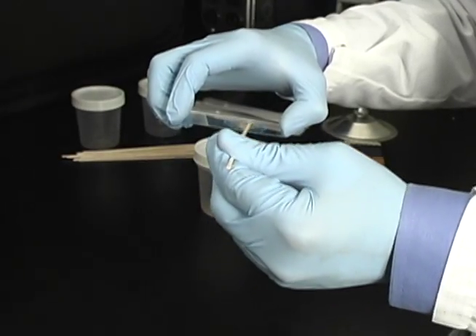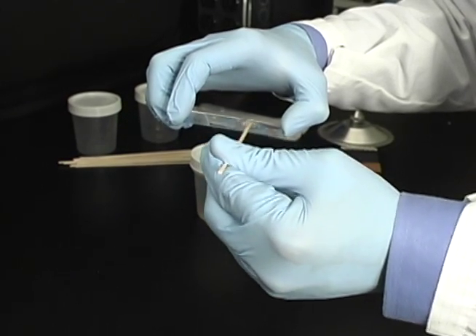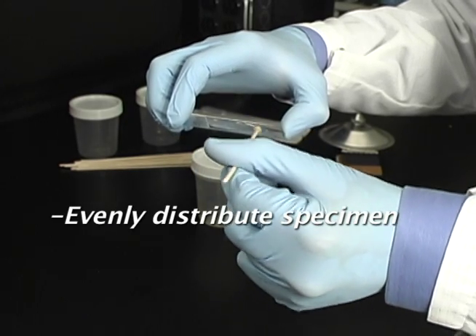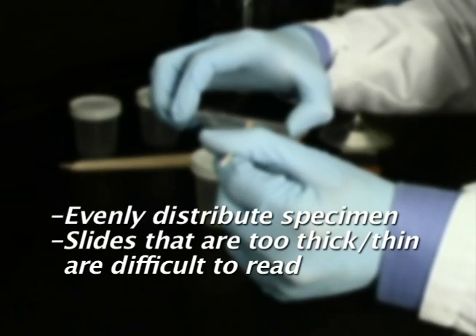Transfer the specimen directly to the SureFocus slide, smearing the entire marked circle with the sample. Make sure that the specimen is equally distributed as much as possible. Slides that are too thick or too thin may be difficult to read.